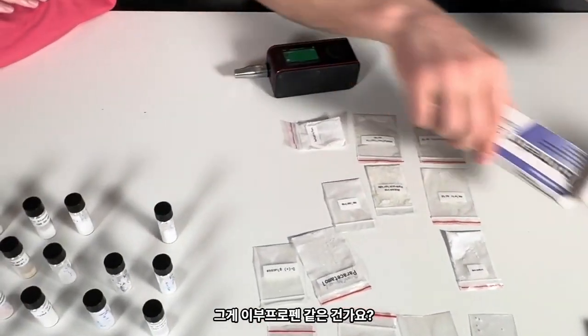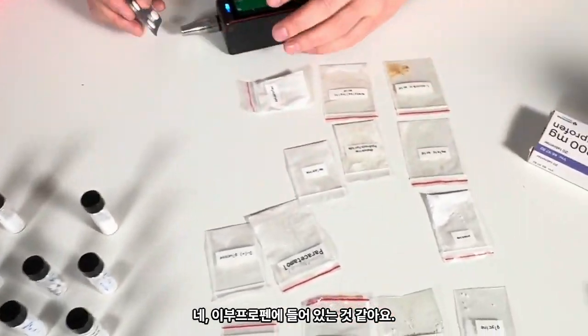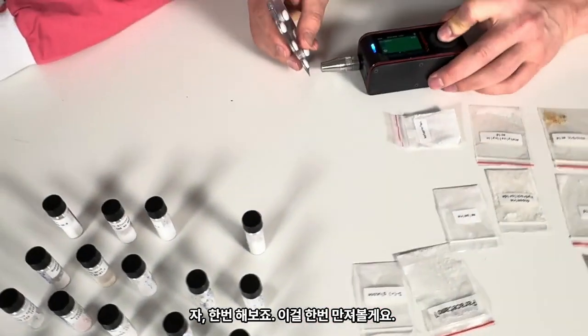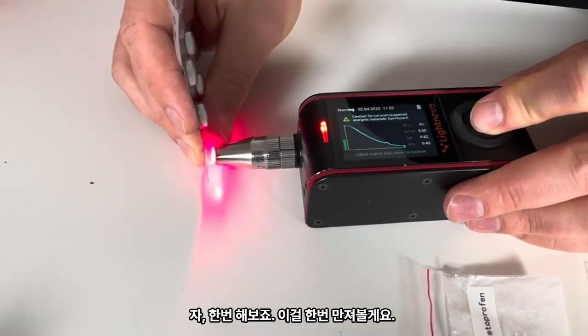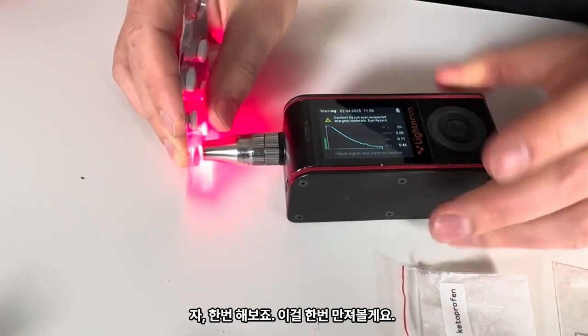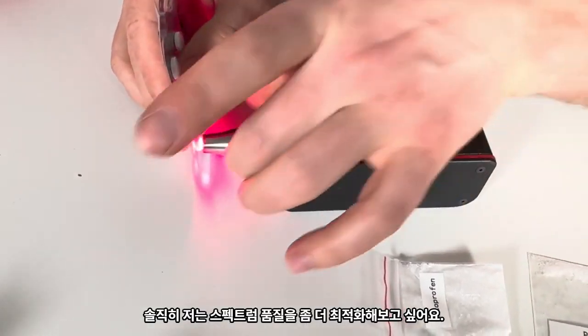There is some other, we have some other drugs here, yes? Is that like ibuprofen? Yes. I think so, yeah. So let's try. Touch this. I honestly would try some more optimization for the spectrum quality.